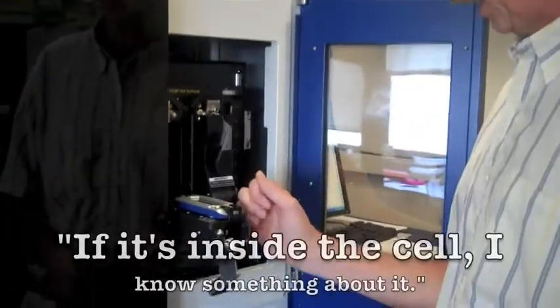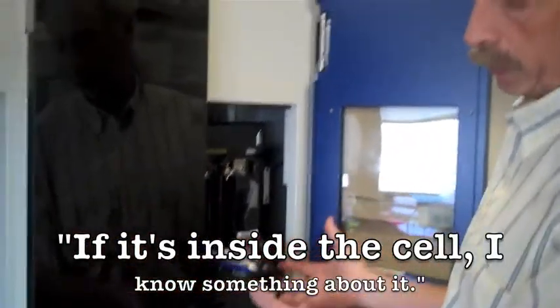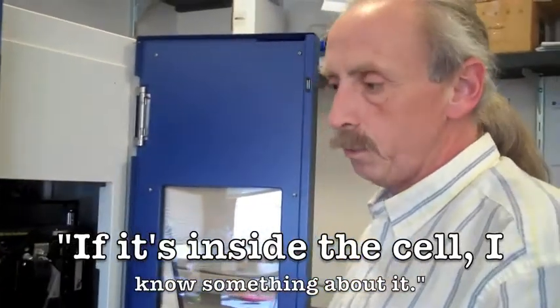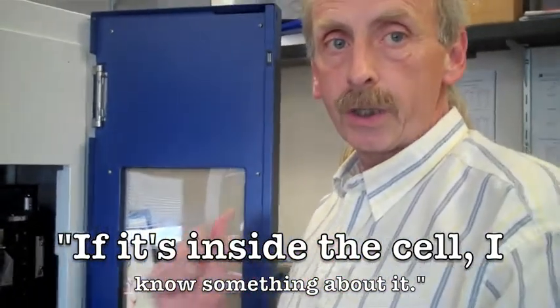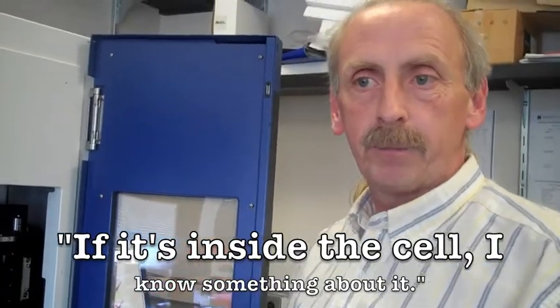on a slide in this chamber, and all of the fluidics are controlled by computer, and we can sample any piece of DNA or any RNA from any source.